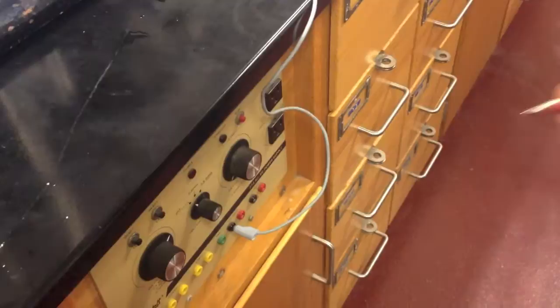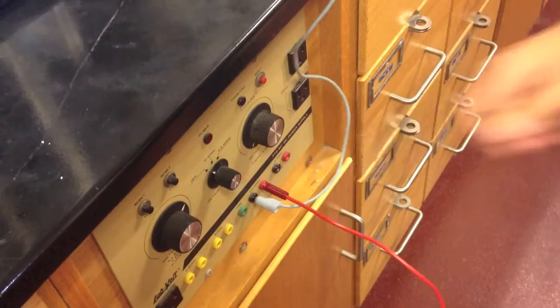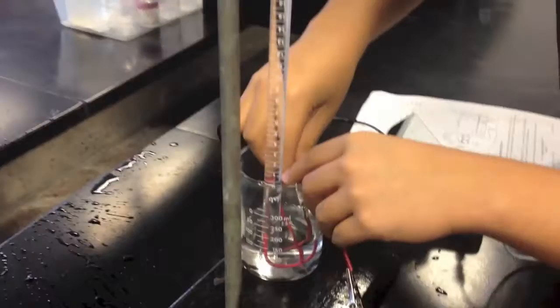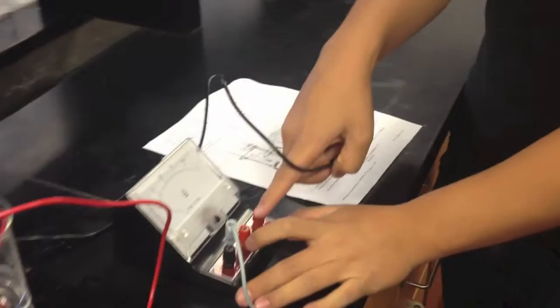Now we're going to connect this and we will insert the other end of the copper wire into the system. Plug it into the positive side. And lastly, we'll be taking the last wire to connect the alligator plug to the copper wire that we stuck to the burette. Now this end, we'll be putting into the plug on the ammeter where it says 1. There you have it. That's your system.